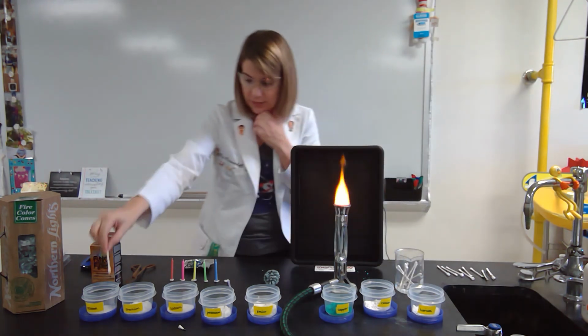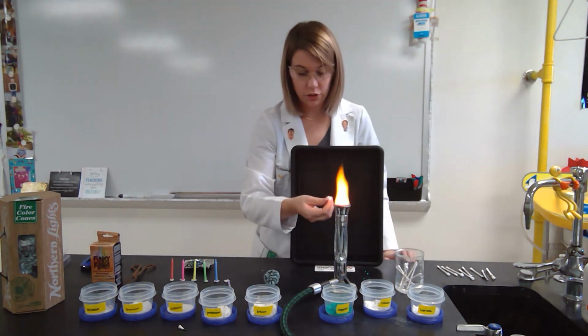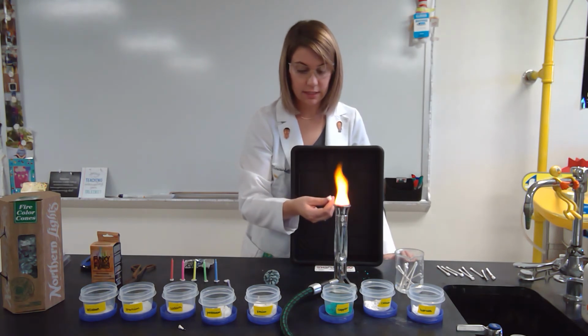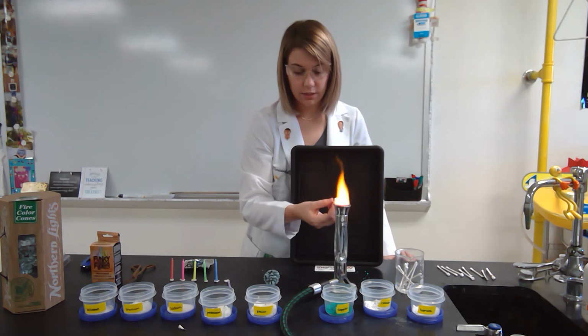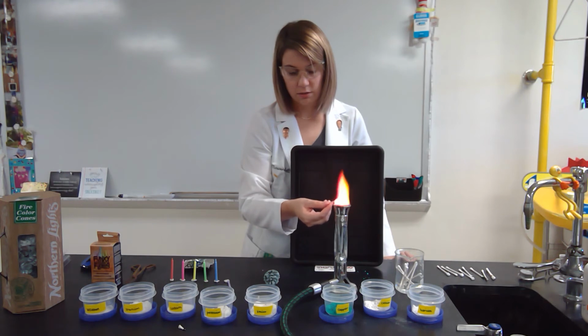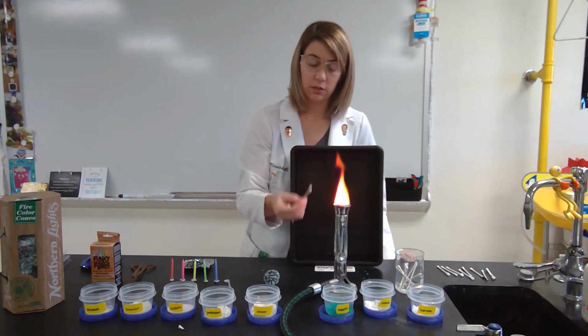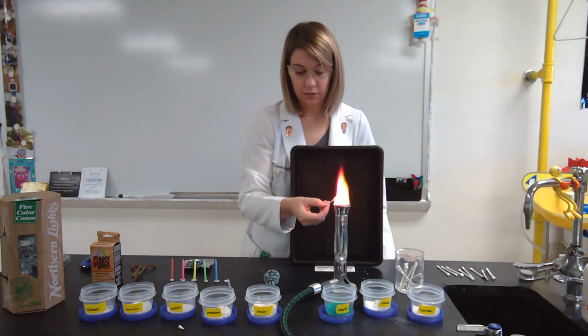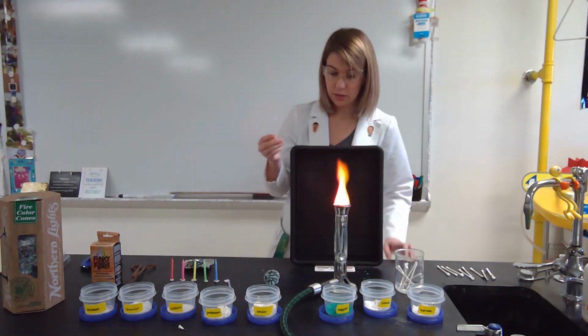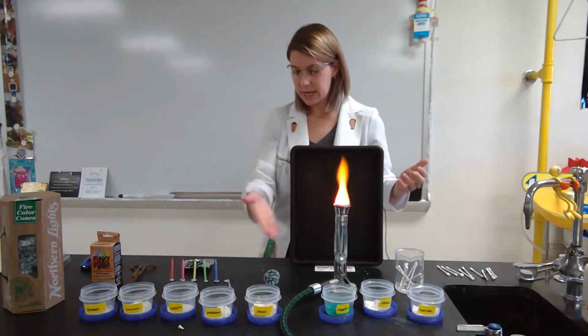And now I'm going to give you the unknown. Again, you're going to look at the unknown and from there determine which of the samples we just tested is in the unknown. So in the unknown, I'm starting to see kind of violet red. So in your lab, you need to think about, for later when you're trying to answer the question of what does this contain, violet red is the observation that I have. So I want to think what element contains violet red that I tested before.